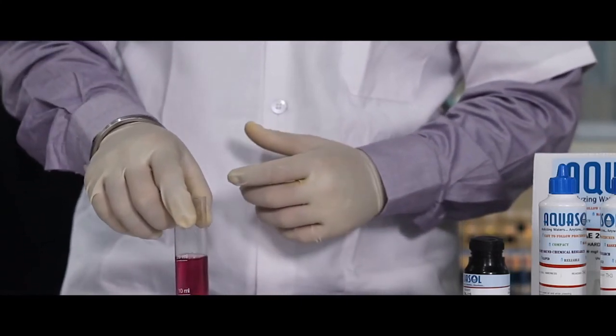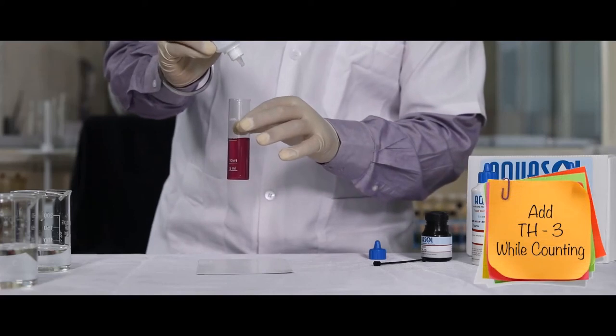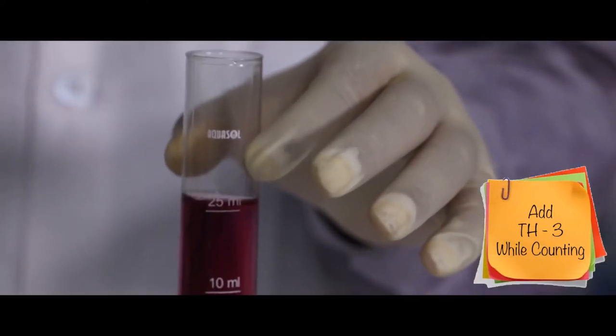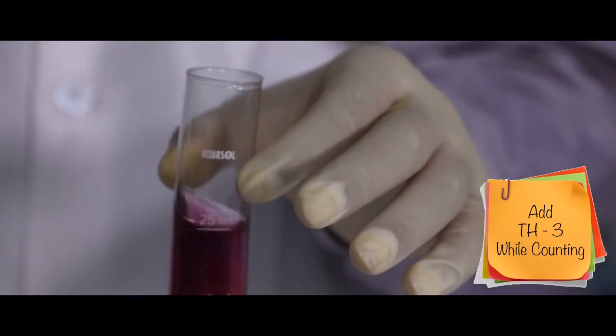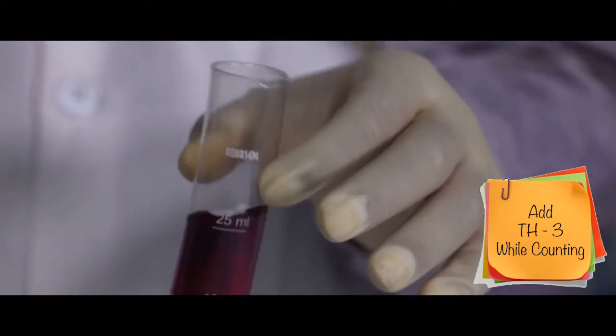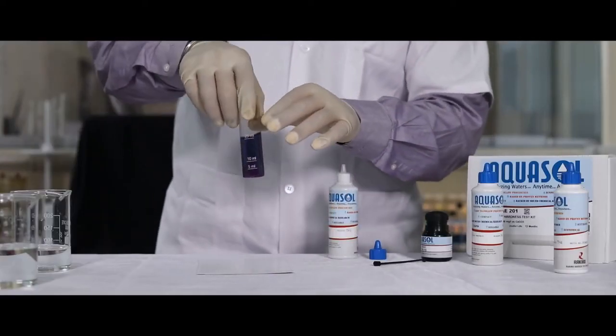Now to estimate the value of hardness, we will add TH3 reagent drop wise. Count the number of drops while mixing until red or pink turns blue.